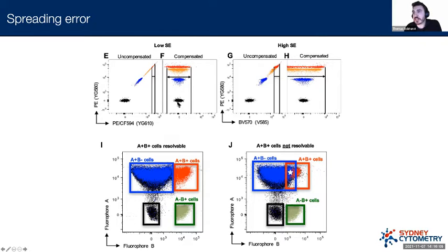When we compensate it, you can see that this actually creates some spread here. Now, importantly, this spread is not generated by compensation, it's simply revealed by compensation. The measurement error here, this spread, is already inherent to the data. So it's already there, we can't do anything about it. All compensation is doing is revealing it by moving all of this data down to the lower end of this bi-exponential scale.